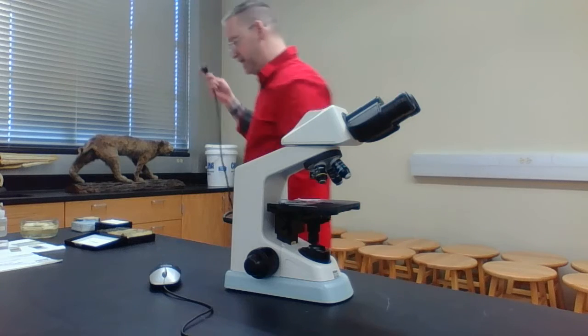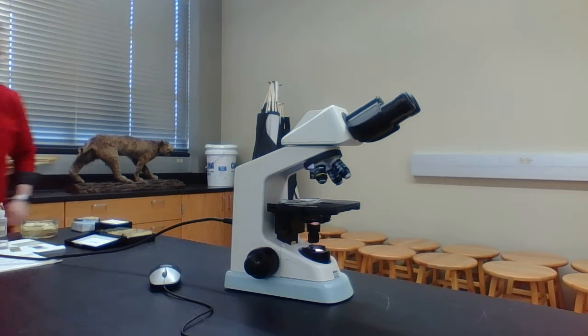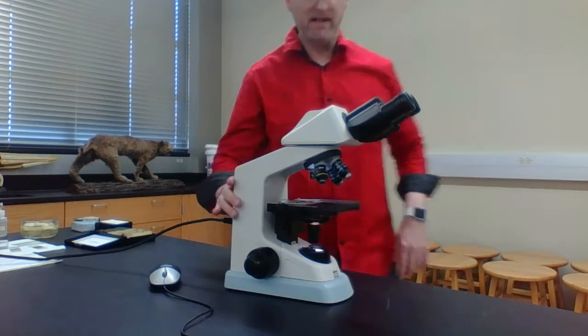So again, I'm going to plug this in one more time. There we go. I'm going to turn my light off.